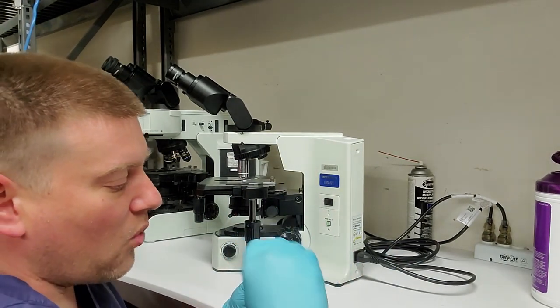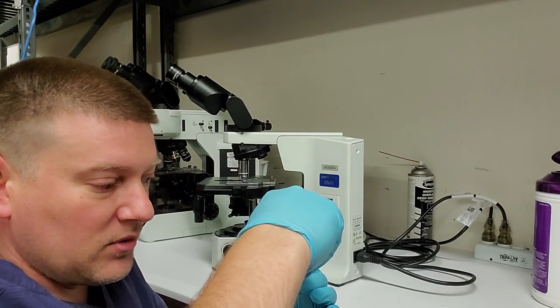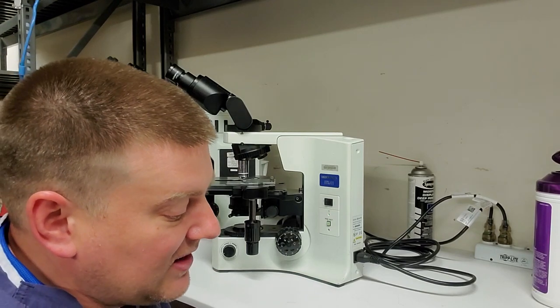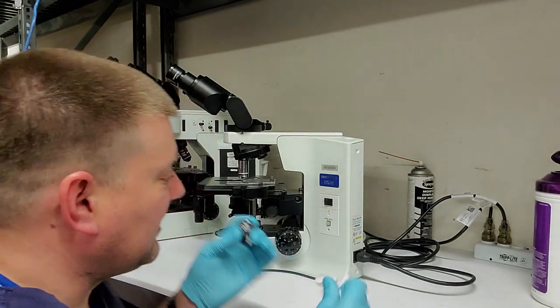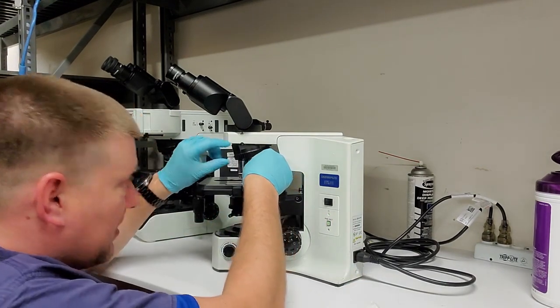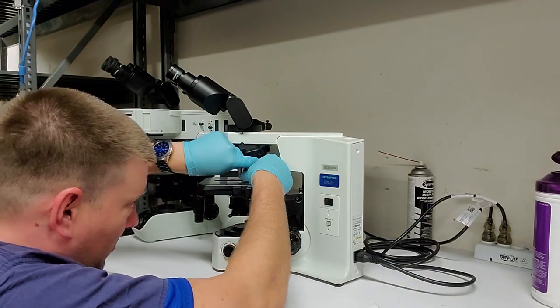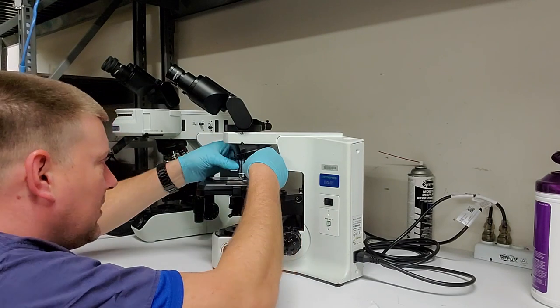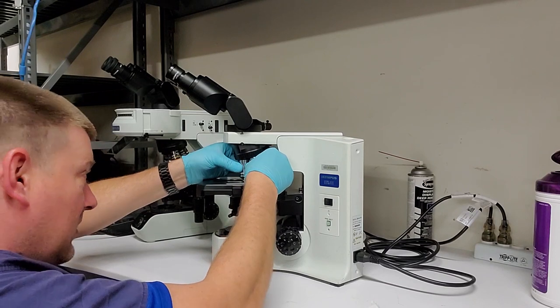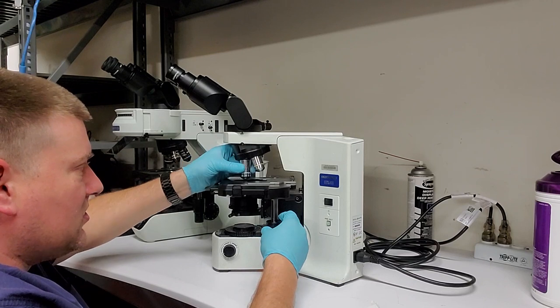So I will wipe it in the same way. I'll give it a little quick scrub. And then we'll take a clean piece and I'll do a circular swipe. Then you hold it at an angle to make sure that the glass is nice and clean. And then place it exactly back where you found it before you move on to the next objective. So here we go, I'm placing it back. All right, so this one here, I'm gonna have to adjust this guy, because you don't want to scratch it.